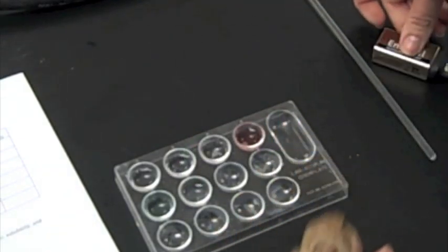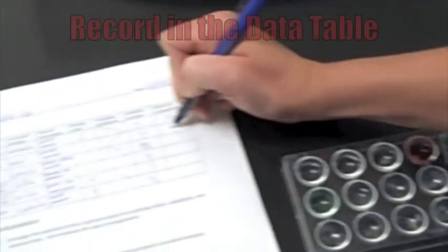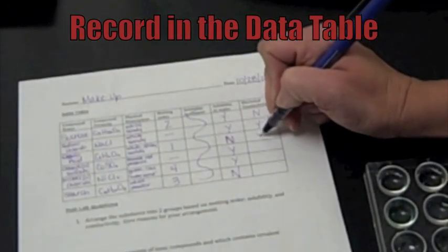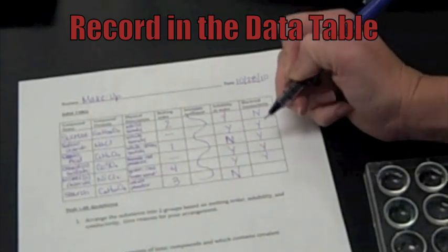So, all of them were conductive except for the sucrose was a no. Sodium chloride was a yes. Oxalic acid, cobalt sulfate, and nickel chloride were all yeses. The starch was a no.